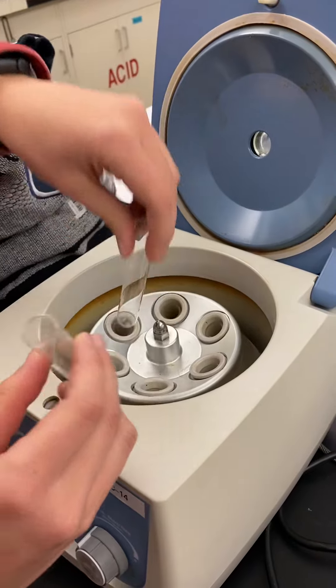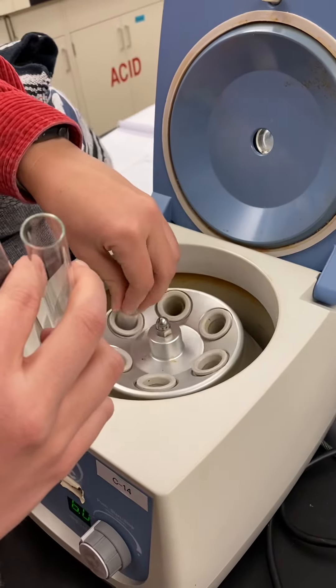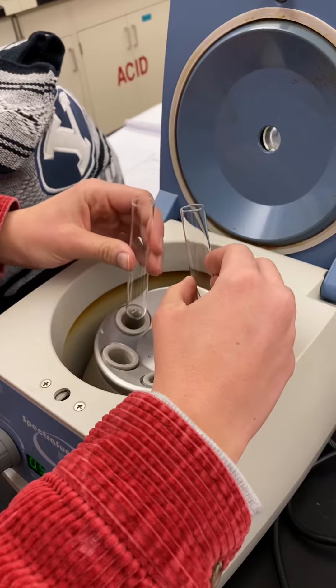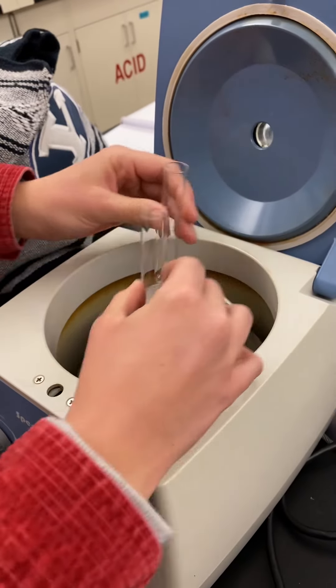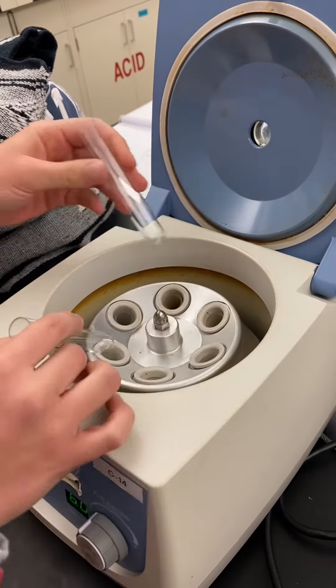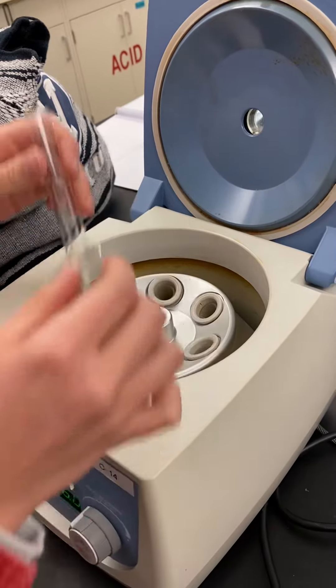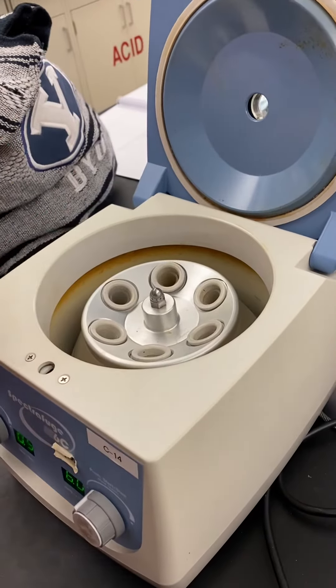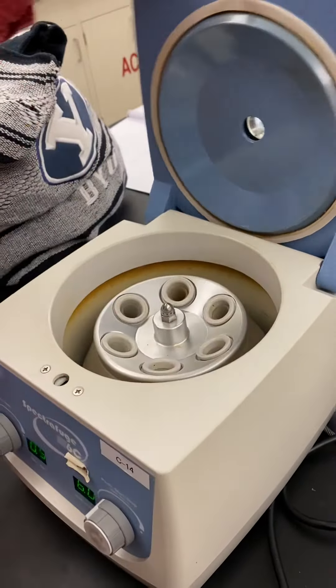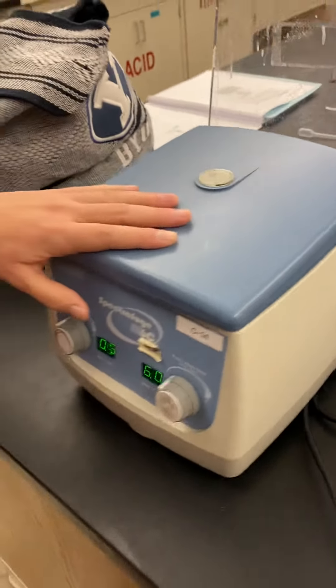The second thing is when you put them in, you'll want to put them across from each other. And if you have three, you can put them in these three or whatever. Then you put them in opposite from each other, lock it.